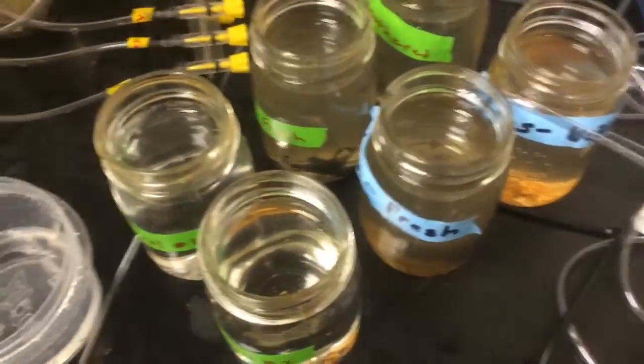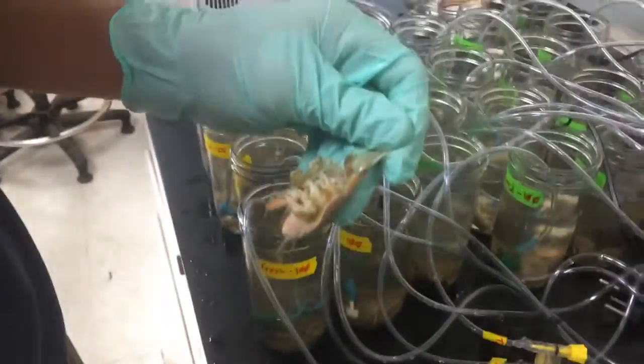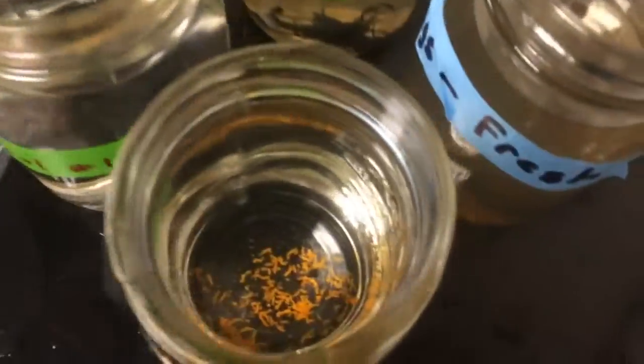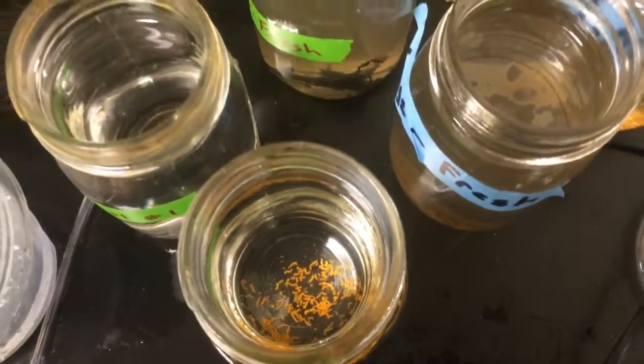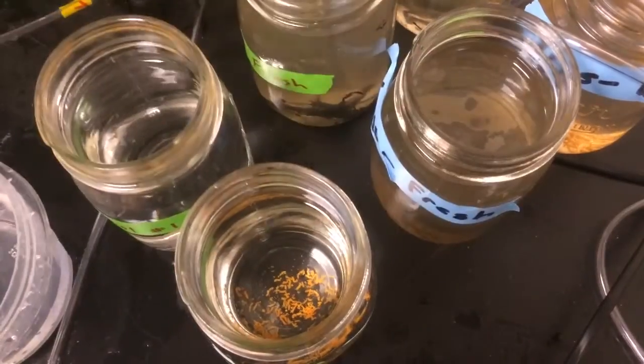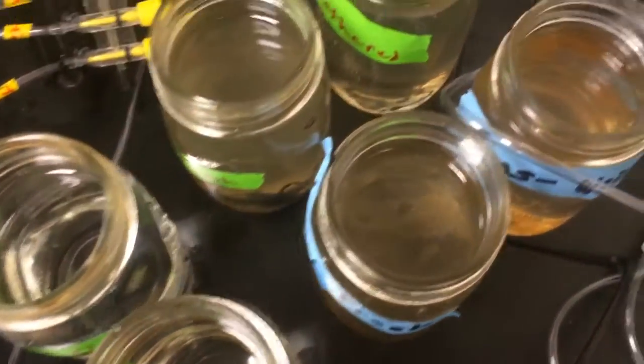Okay, this is our other experiment and so Chase is excising some eggs from a gravid female. These are relatively young eggs. These have another couple weeks before they reach full maturity.